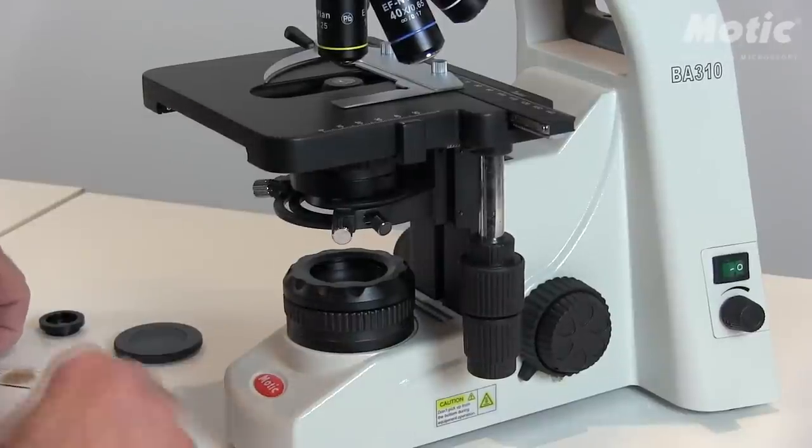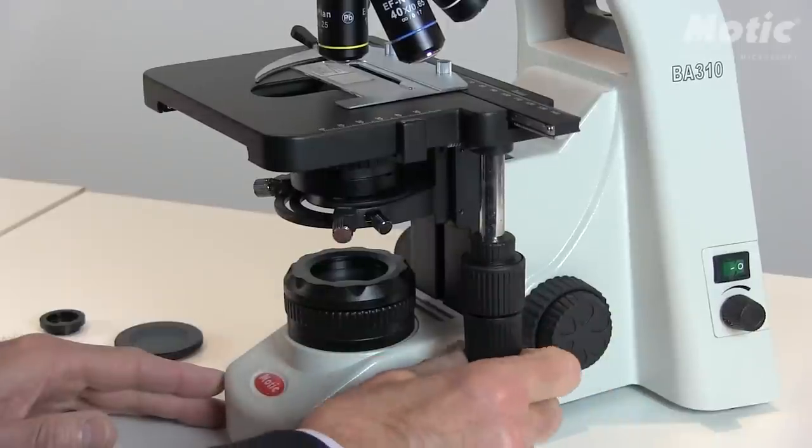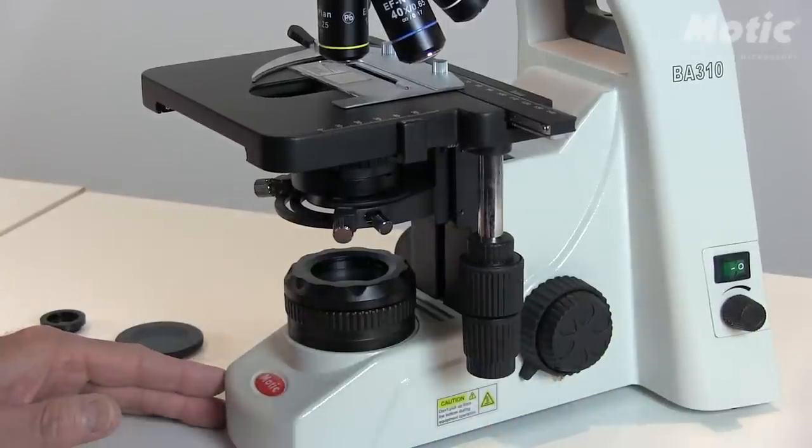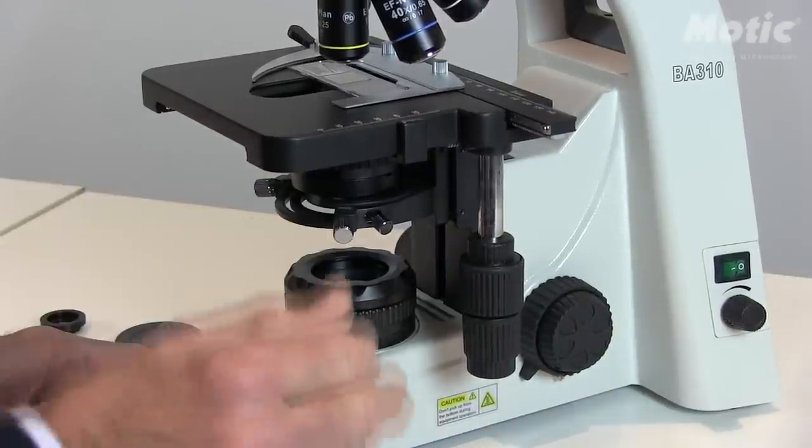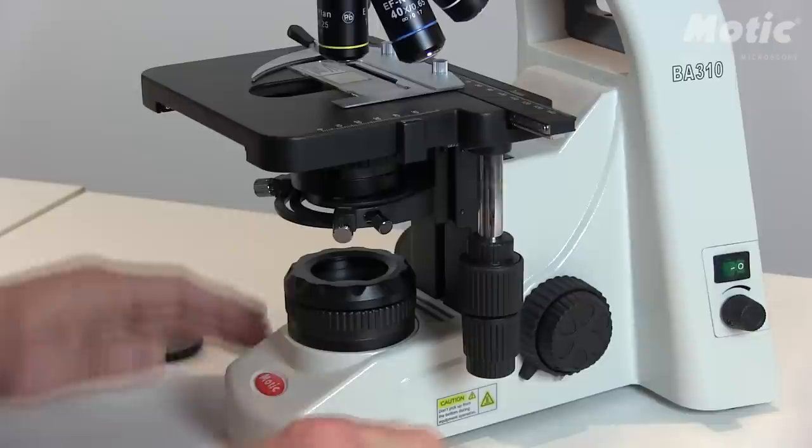Now I am going to take my sample, place it on the stage, and of course then do a proper bright field setup for the BA310, BA310 elite in this case. This means that we have the Köhler illumination. You know this already.